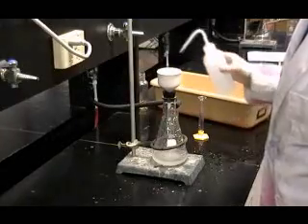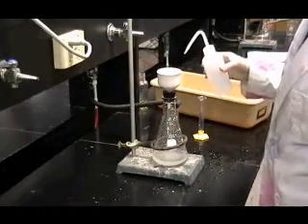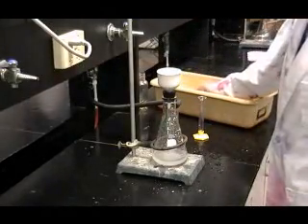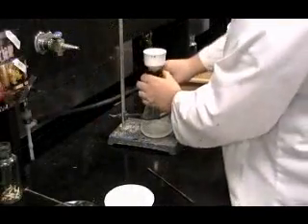After washing the aspirin, allow as much liquid as possible to be drawn away from the solid by allowing it to remain under suction for 3 to 5 more minutes.